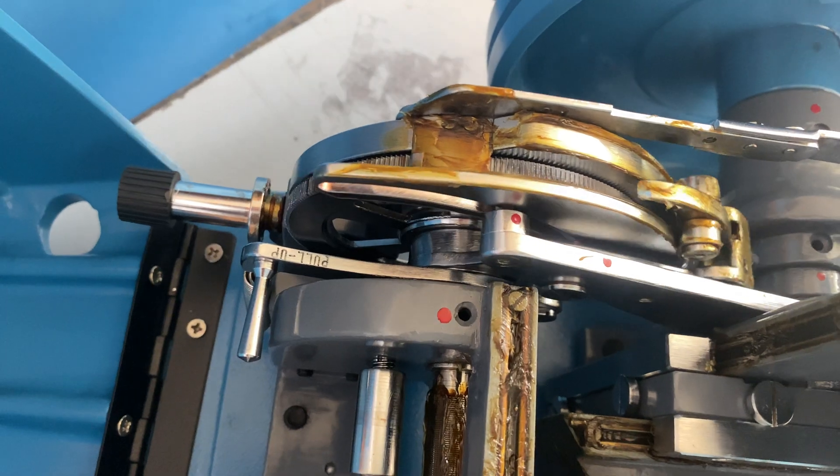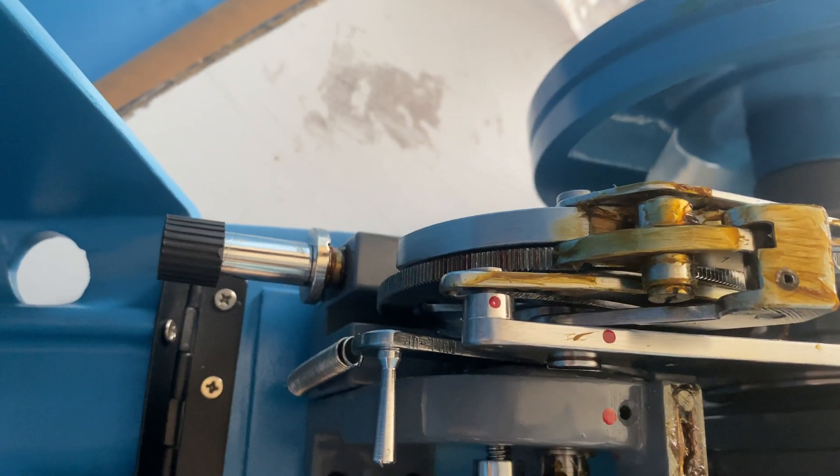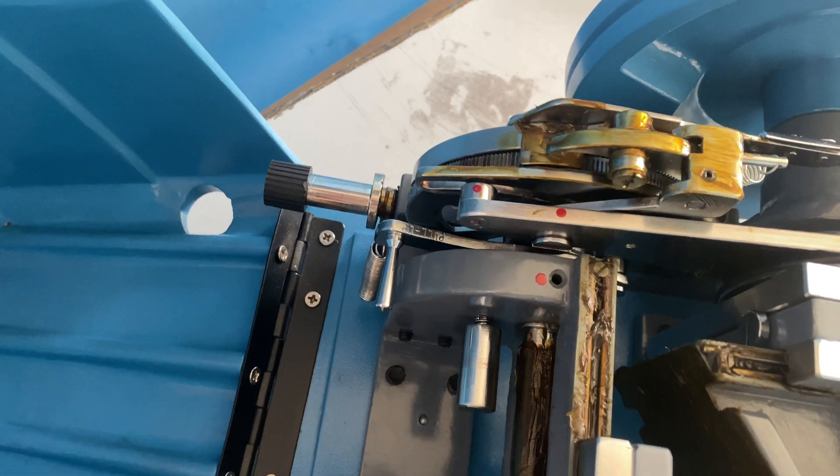When you move it, it will come to this section. At 10 microns, 10 steps will be changed. For 5 microns, 5 steps — this is a facility available on the microtome for precise sectioning thickness.